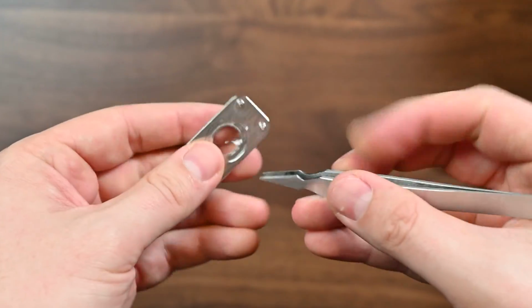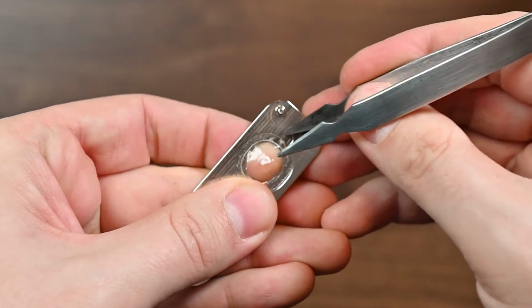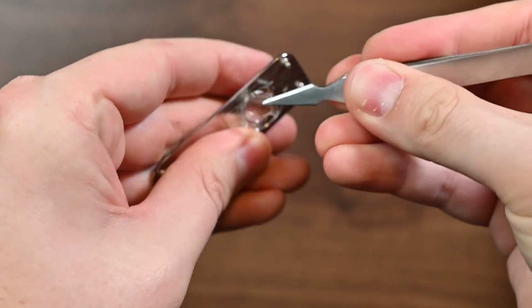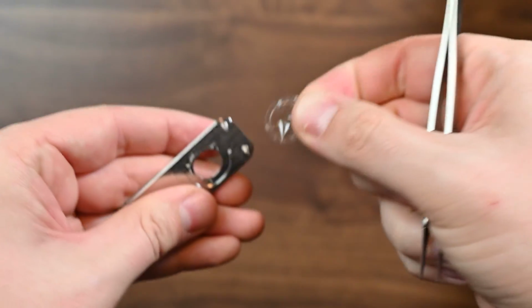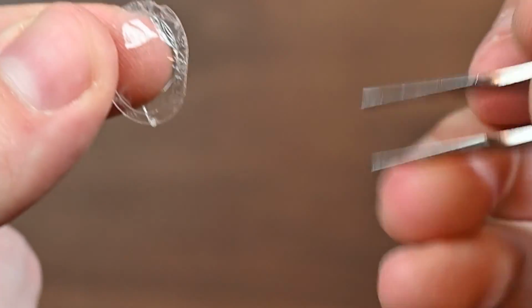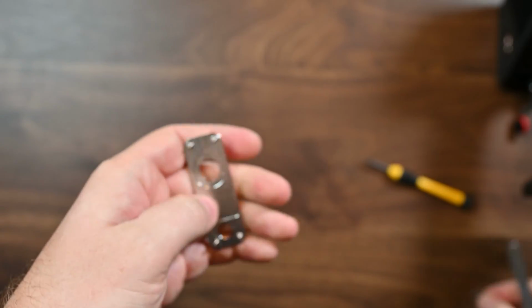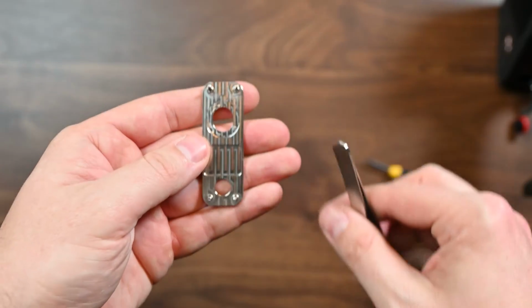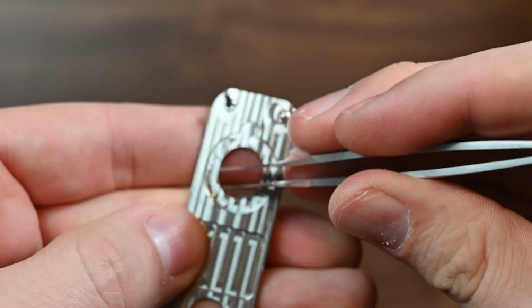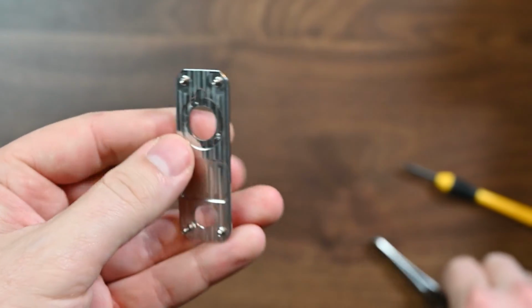So what we're going to do first is we need to remove this old window. So I'm just going to take my tweezer here and I'm just going to peel off the exterior, and you can see that it comes off pretty easy. We'll get as much of that adhesive off as we can, and there you go. There's the old window with a hole in it. I mean, I put the hole in it, but you can see that it's just a plastic scaffolding. So we'll set that aside. We can discard that later. Around the edge here, we want to make sure that any loose pieces that are still there get removed. This one should be clean enough for what we're doing today.